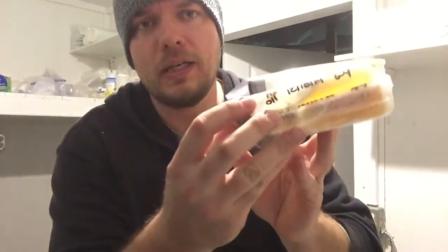But another example would be, let's see if I have an interesting one here. Well, this is Hypholoma sublateritium. This is otherwise known as cinnamon caps, and then you can see this is recorded as G4. And I've actually had this strain since 2012. I traded actually from Scott Henderson, who's known as the Mushroom Man out of Vancouver, and then he actually acquired this strain from Bill Chalmers. And you know, if you're careful, you can keep a strain alive for many years. So you know, I've kept the generation value of this down to G4. It was given to me actually at G2, and I've actually held on to this strain for about 4 years now.